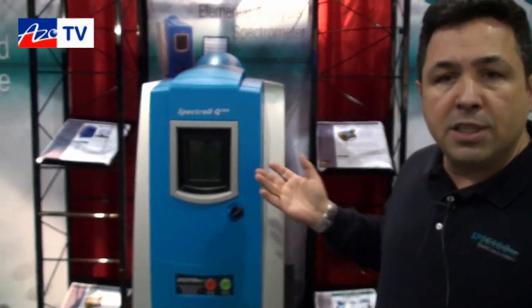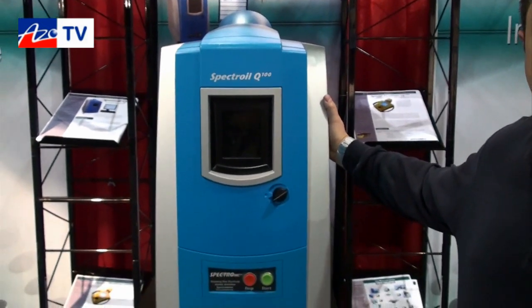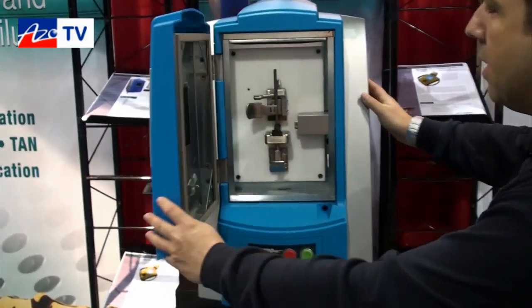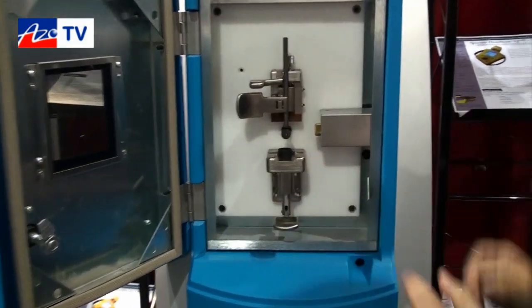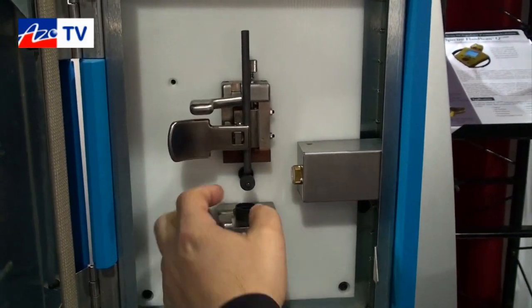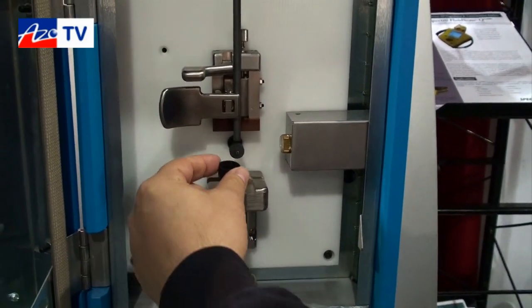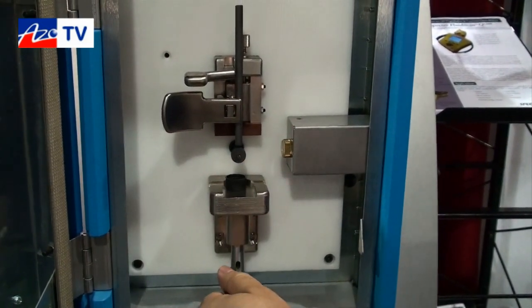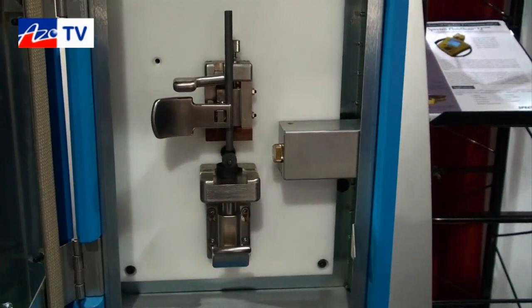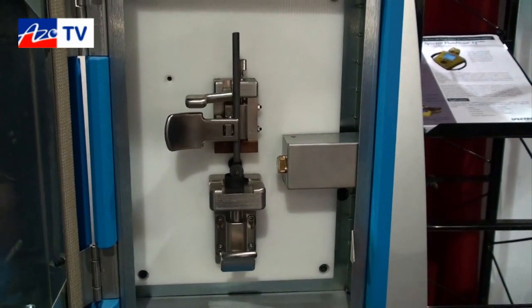Let me show you — the instrument is very small. It's our new generation. It has an optical system on the right-hand side with multiple CCDs. It's a very simple instrument where you just put a sample of oil, about two milliliters, that does not need to be prepared or diluted. You just put the sample directly as it is, and once you have the sample in the sample cup, this disc electrode made of graphite rotates and while it's rotating it's taking the sample around.